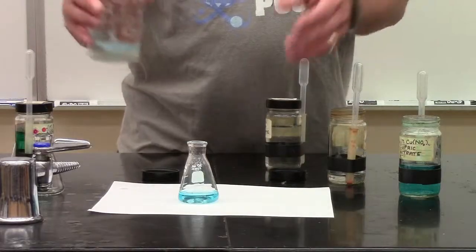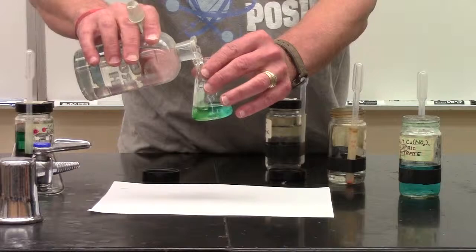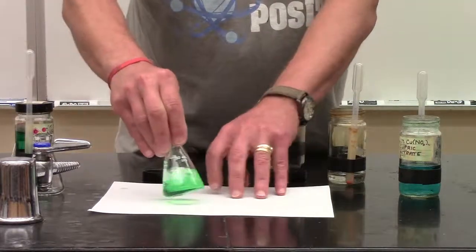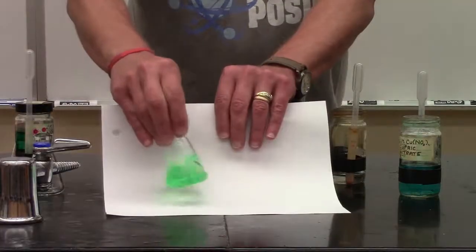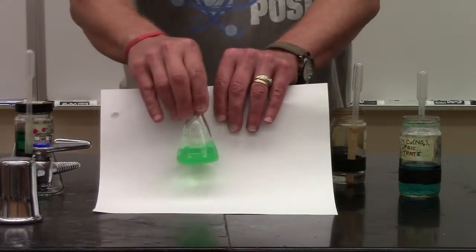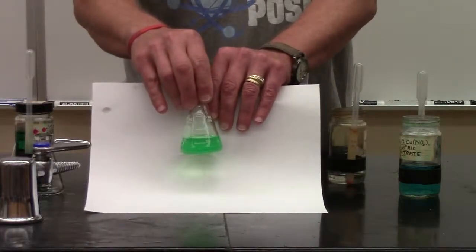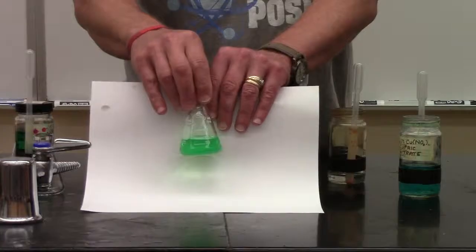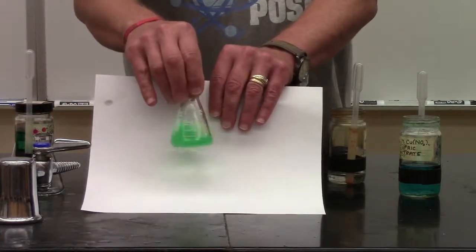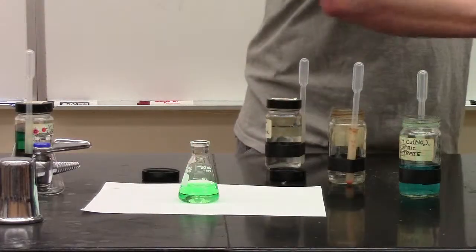Now I'm going to add some hydrochloric acid. And I think you've seen, we have this green color now. It looks almost fluorescent. This is actually a patina. If you ever look at a copper roof on old state buildings, capitols, you'll have that green patina. And that's what you're getting, actually a reaction with the chloride ion. And of course, maybe you don't like that color green.